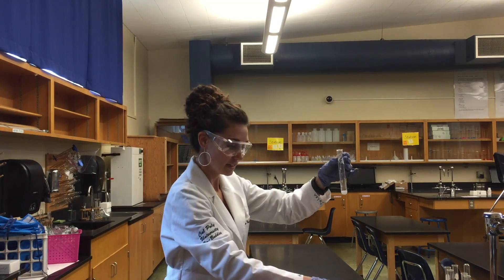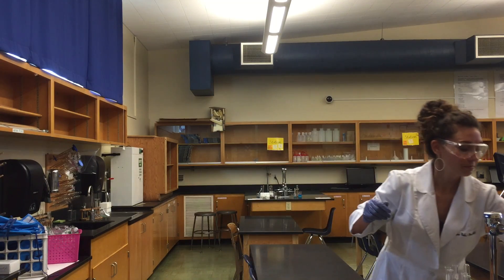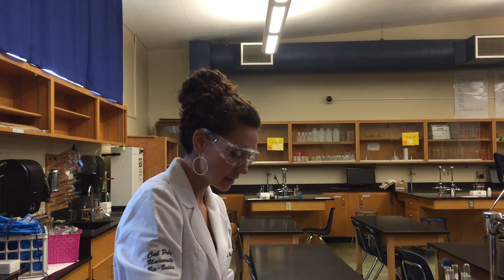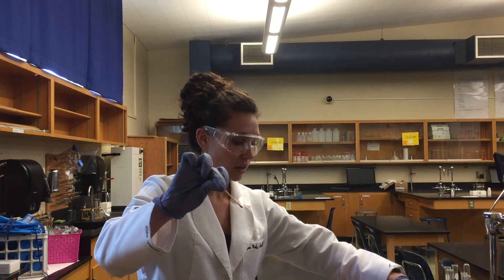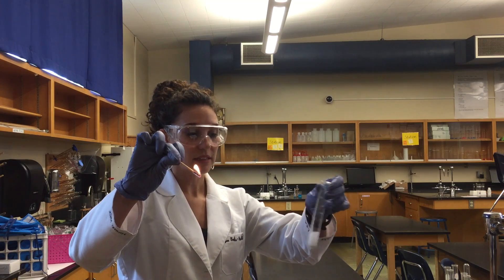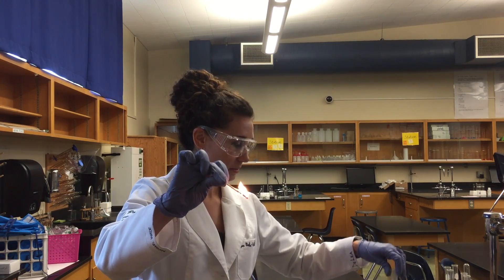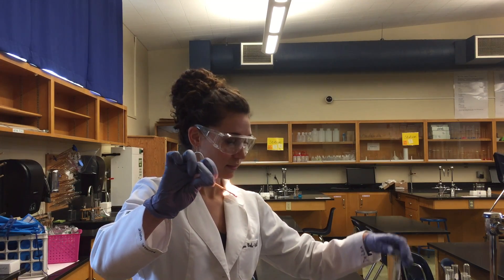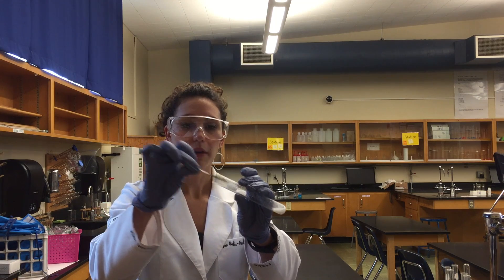I can test the presence of carbon dioxide by grabbing a match. A match will stay lit as long as there's oxygen present — it's doing great. But in the presence of carbon dioxide, this match will go right out.